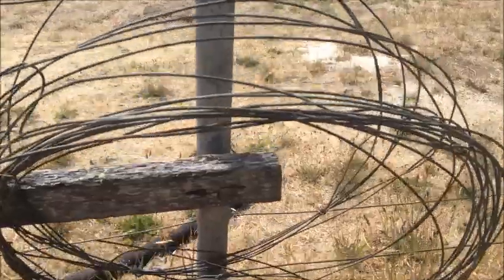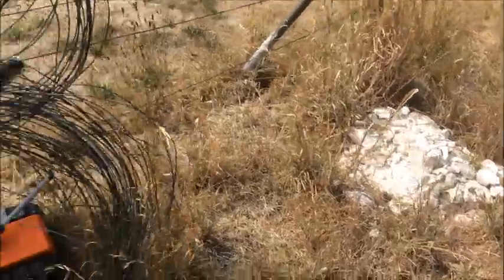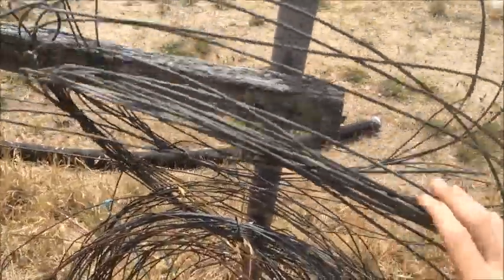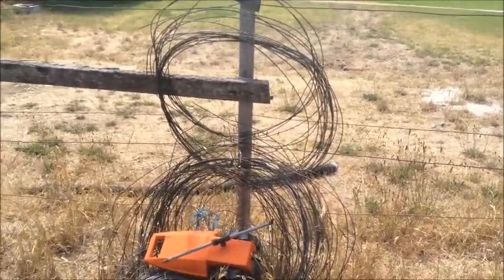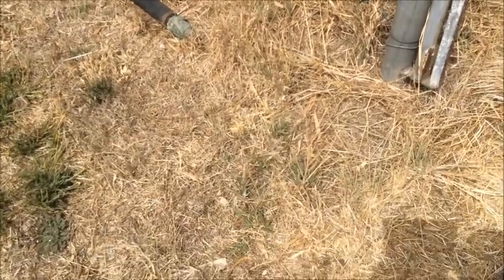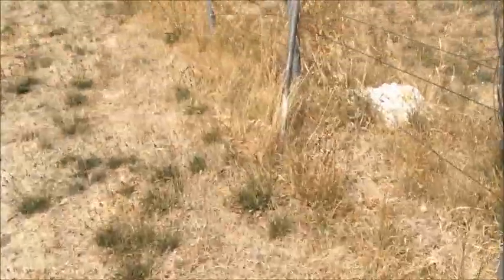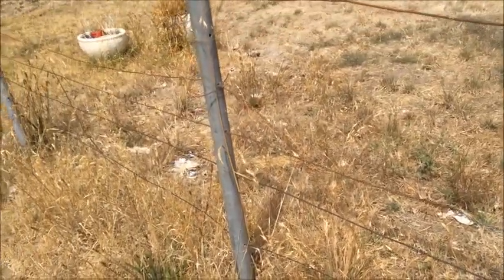This is what I mean by a lot of scrap iron — this is just fencing and stuff. That's a pile of calcium oxide and carbonate which I just haven't got around to doing anything with. While this might not be the most efficient method — you know, I could probably just buy iron oxide for dirt cheap off the internet — it's really good to get rid of some of this, because a wire like this just sitting out there could wreck a mower or people could cut themselves walking past. So basically I've got to get rid of it anyway — I might as well just turn it into iron oxide for the price of salt and electricity.